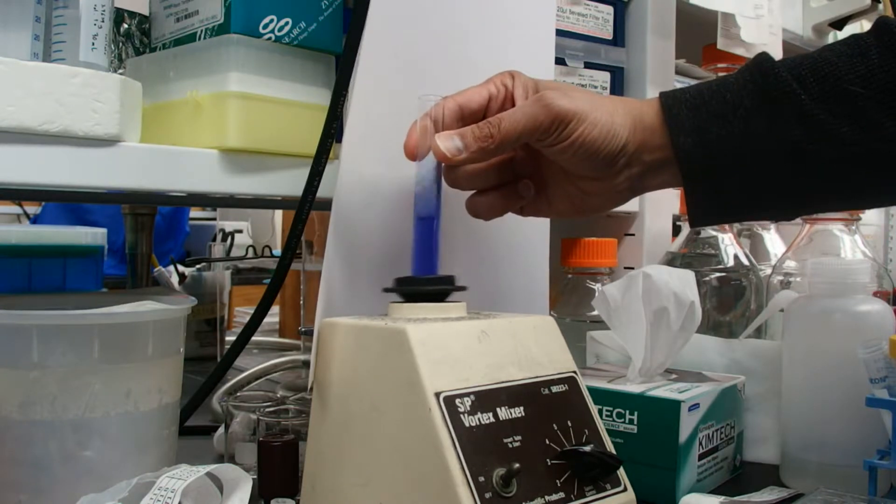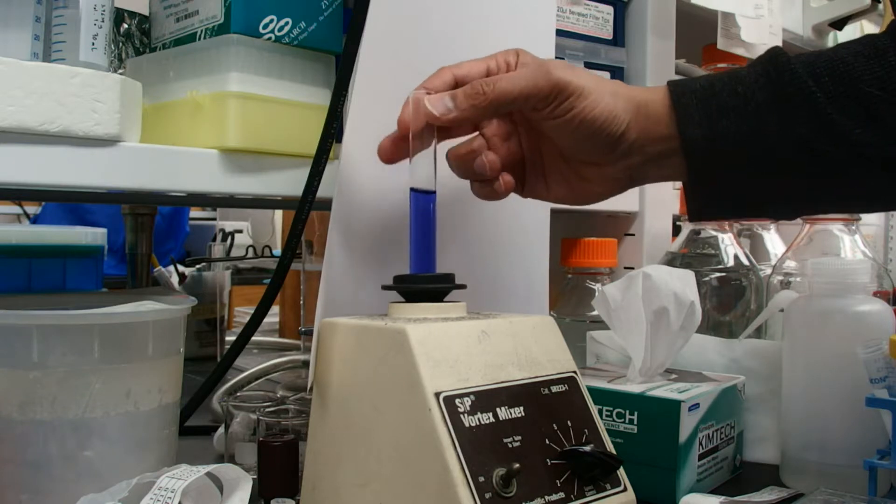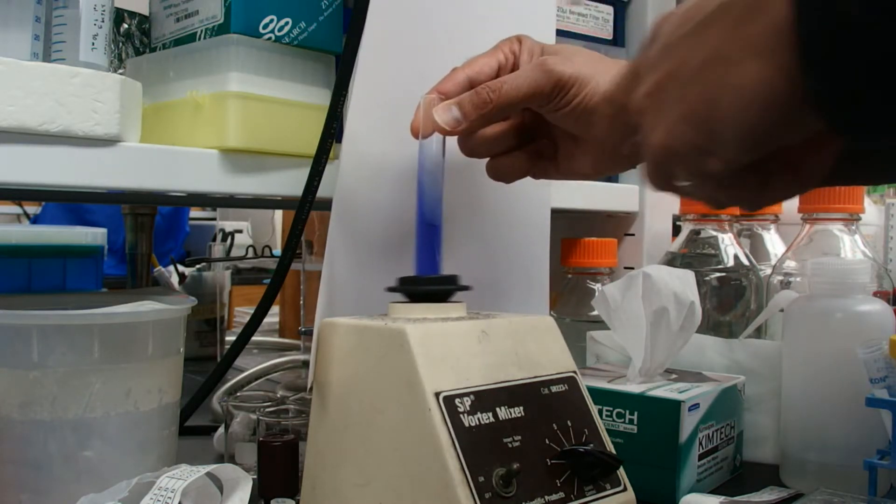So watch this. If I move my fingers, I can move the swirl down. If I move my fingers up higher, the swirl goes up higher. It normally goes right to where your fingers are.